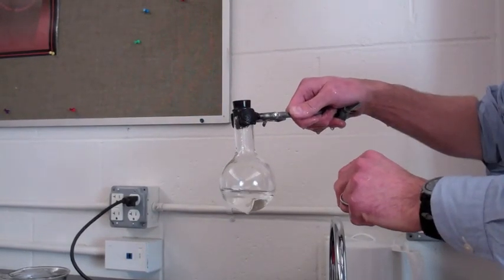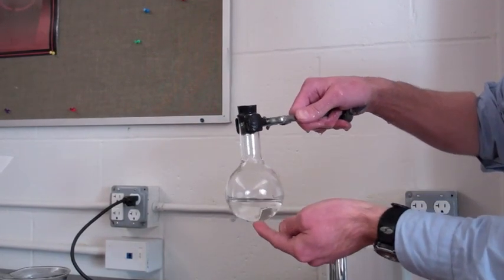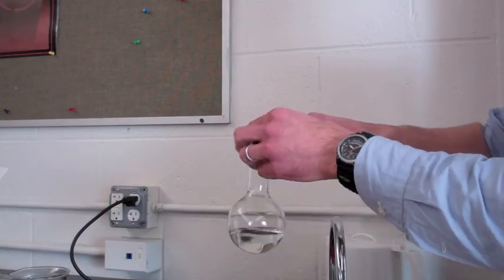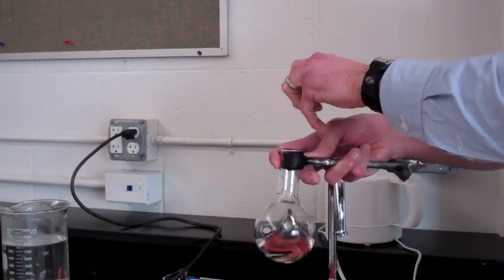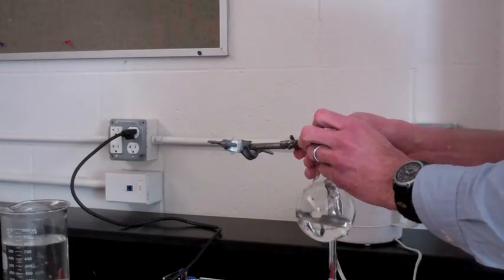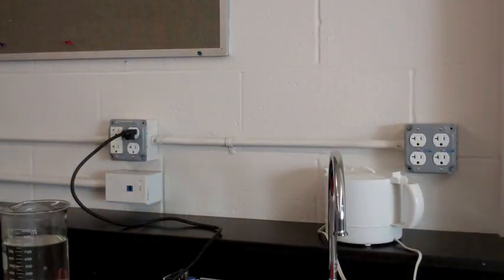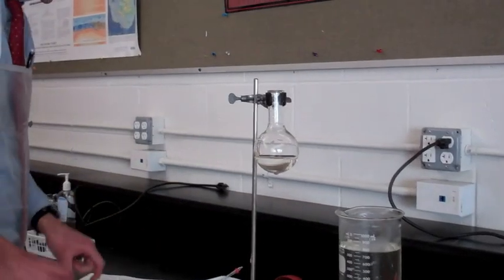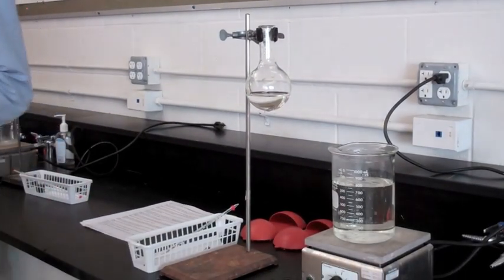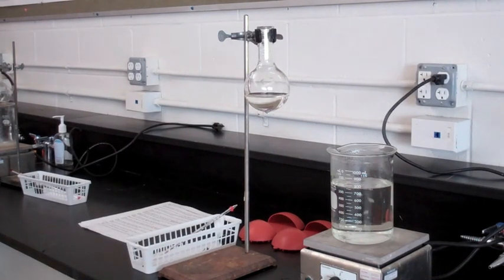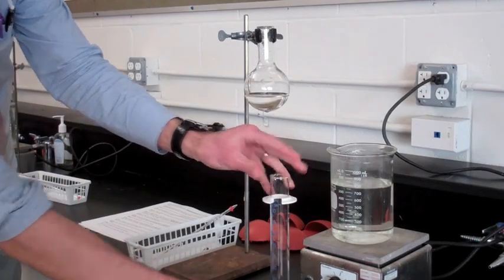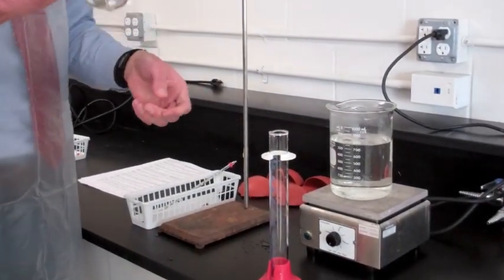Now, it's fine to take this off, because all we need to do is measure the volume of water here, and then we can figure out the volume of air here. But there's one more piece of information we need to know. What is the volume of the flask as a whole? We're going to take this off, and we need to get a graduated cylinder, which we forgot to put out. Thank you, Ms. Milliner. I'm going to put the stopper back in my basket so I don't lose it. And here comes Ms. Milliner with our graduated cylinder.